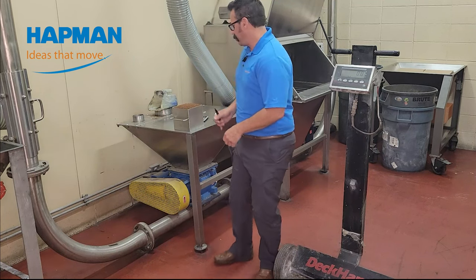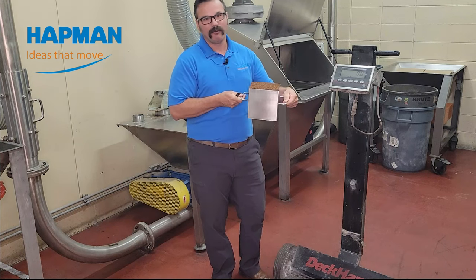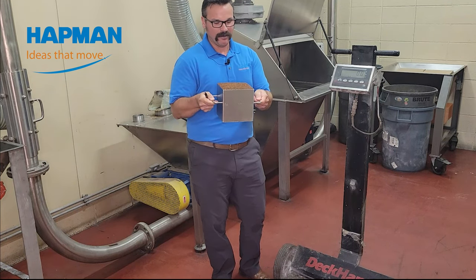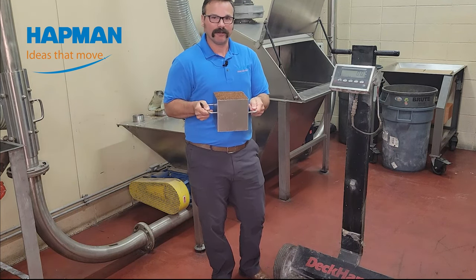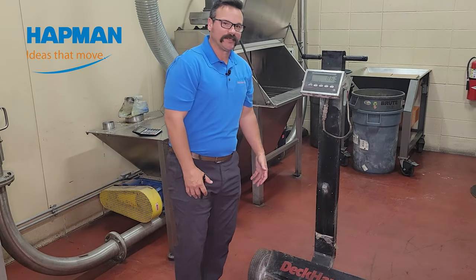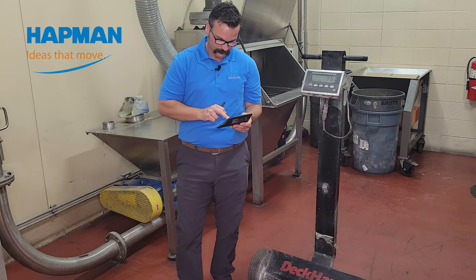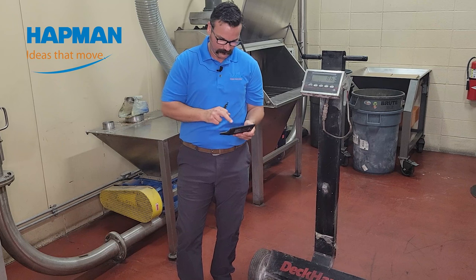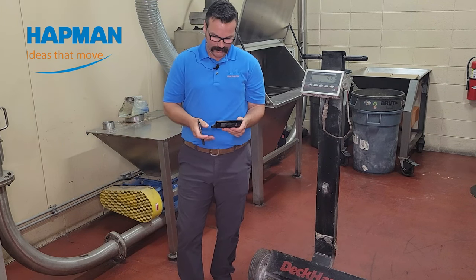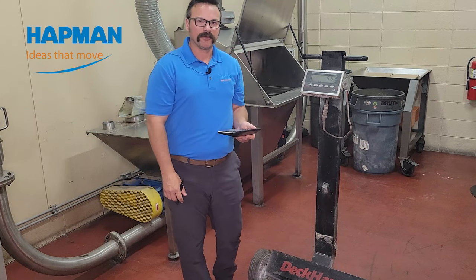It's pretty easy for us to do here in the lab. We had this box worked up for us — we know that it's exactly 3.8 pounds and exactly one-eighth of a cubic foot. So if I weigh this material, it's 8.6 pounds. From there, we remove the weight of the vessel: 4.8 pounds times 8 gives us 38.4 pounds per cubic foot.